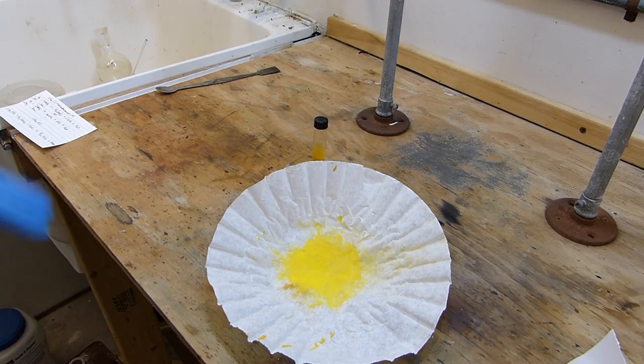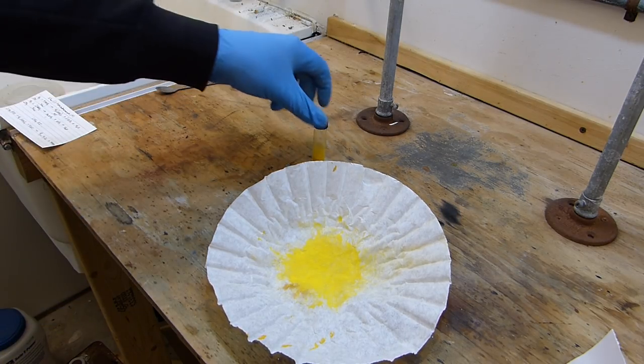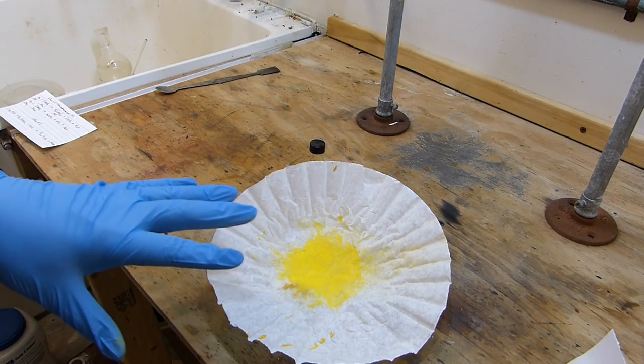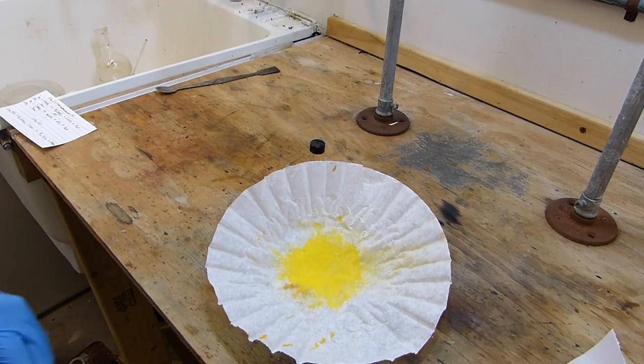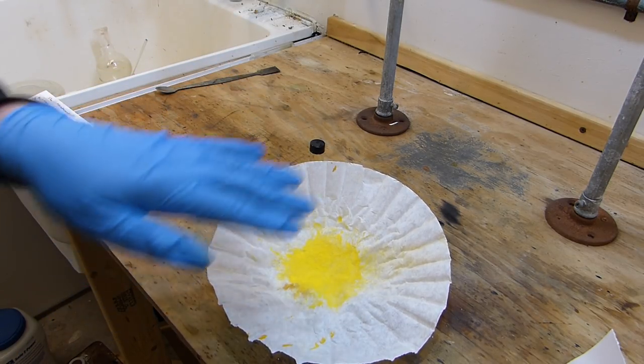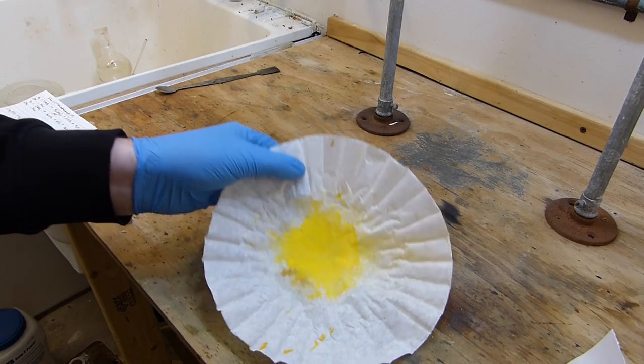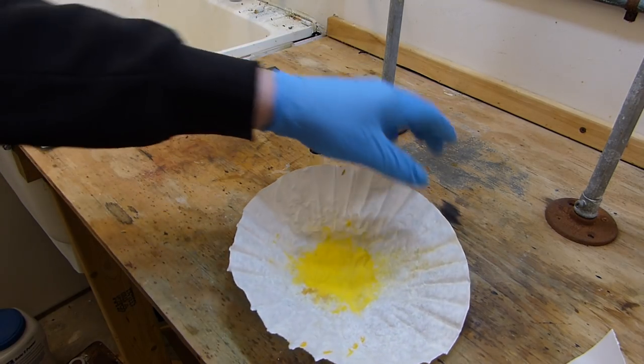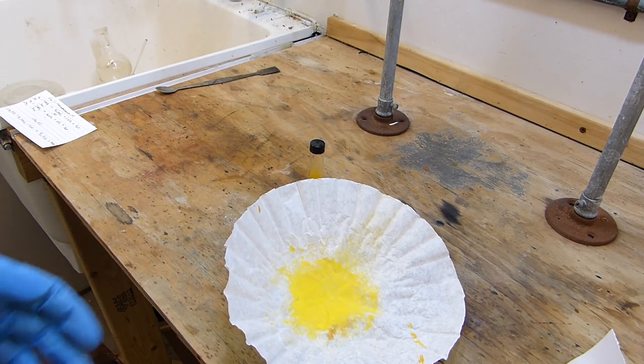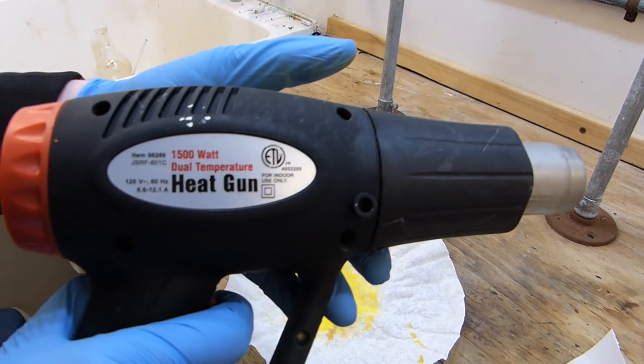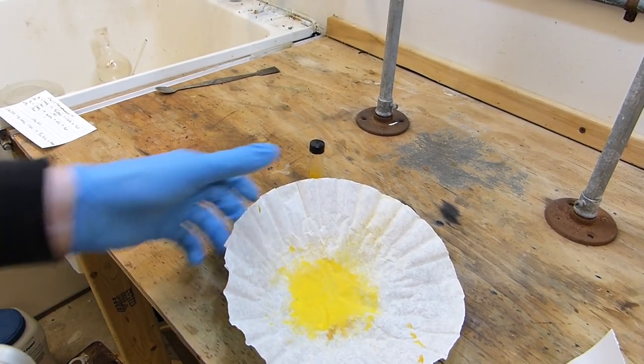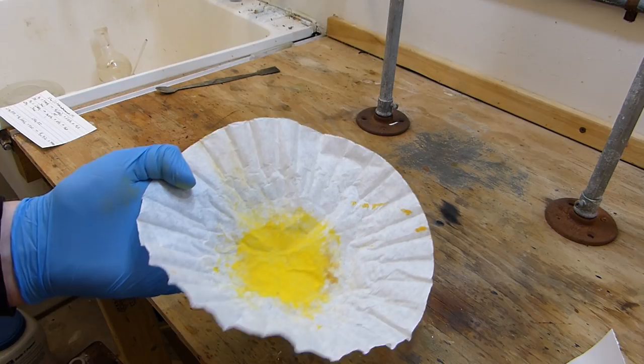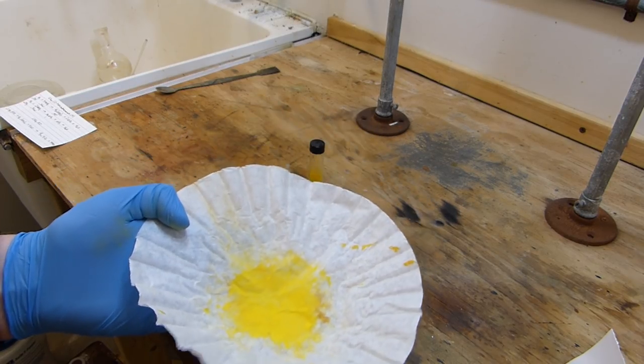All right, and now for what everyone's been waiting for, the demonstration of the thermochromic properties. So I have here the powder, the silver tetraiodomercurate in the vial, and I also have a filter paper here which has been scraped free of residue, which means that essentially if I blow on this it's not going to spray it all over the room. It's basically just the material that's impregnated into the paper that's left. The reason I want to use the filter paper for this demonstration is because paper is very thin and it heats and cools extremely quickly, and so the effect is really easy to see. So I have here this heat gun which is basically a glorified hair dryer, and I'm going to pick this up and I'm going to apply heat to this, hot air, and you'll see it change very rapidly from a bright yellow to a dark orange.